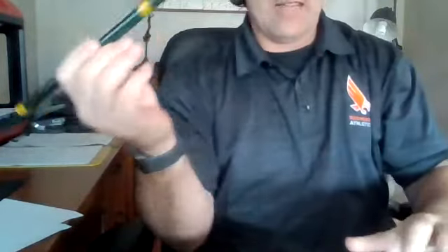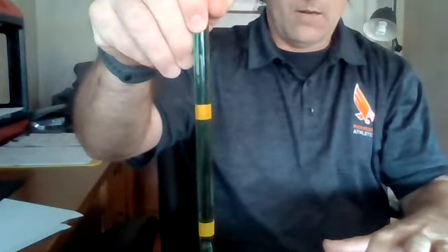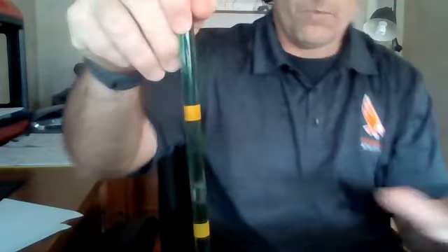All right, our last 3, we have red at 10. Here we go. 0.9. Green at 10. 2.5.